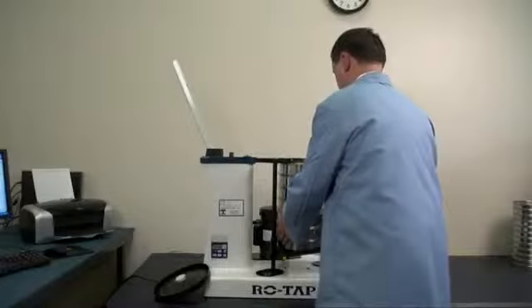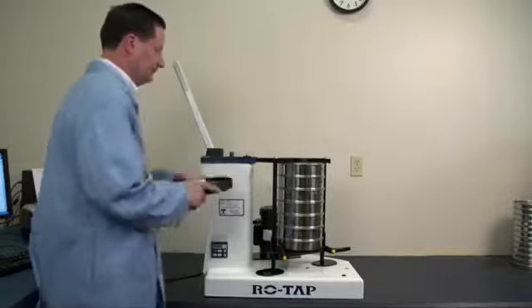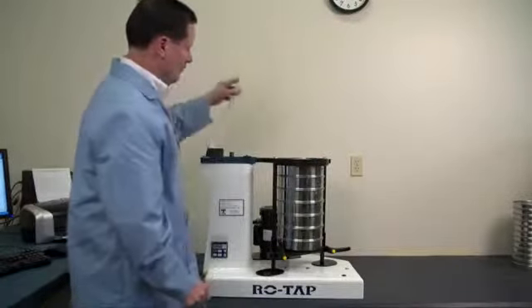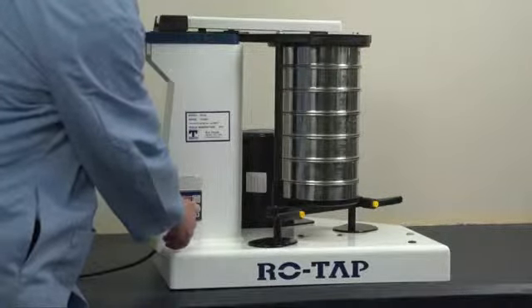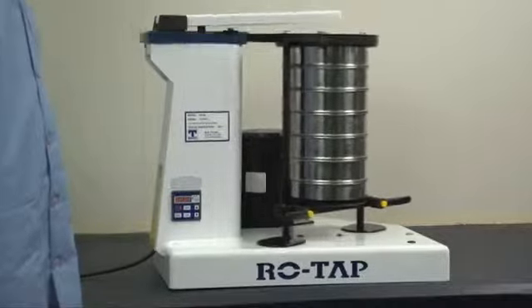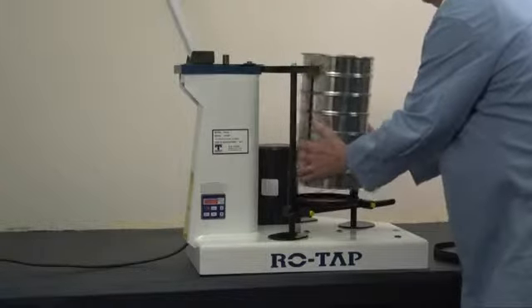Place the stack into the sieve shaker with a cover on the top sieve and securely fasten the stack into the shaker. A sound enclosure cabinet can be used to reduce operating noise levels. Set the desired time limit and start the shaker. The time limit is generally an instruction included in the product specification. When the test is complete, remove the stack of sieves from the shaker.